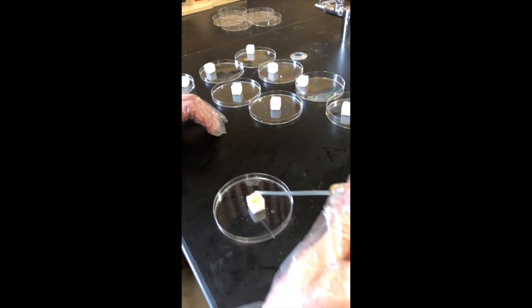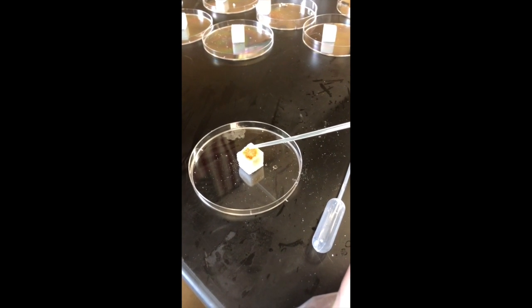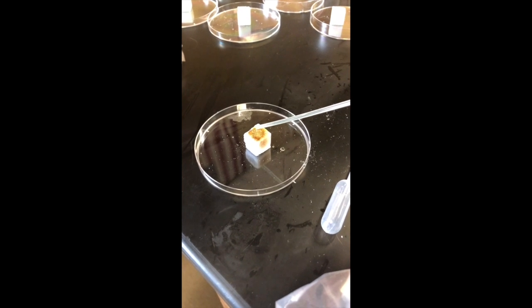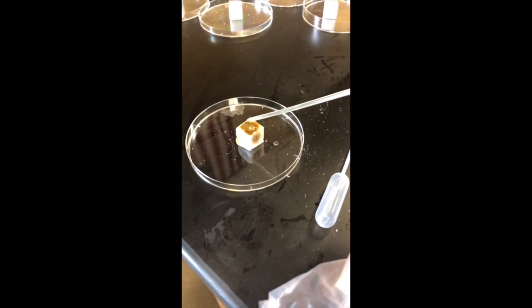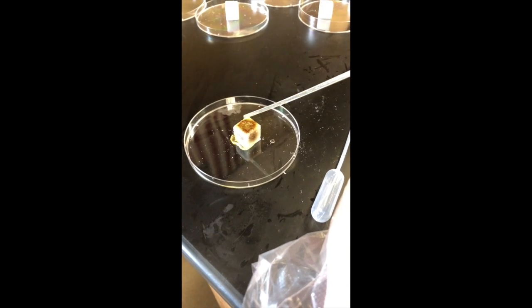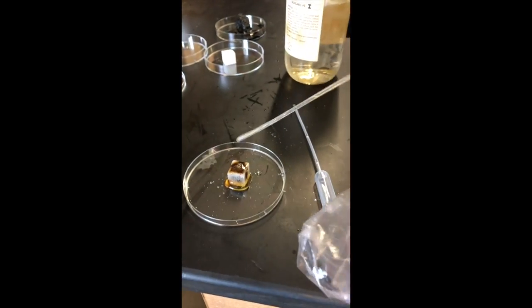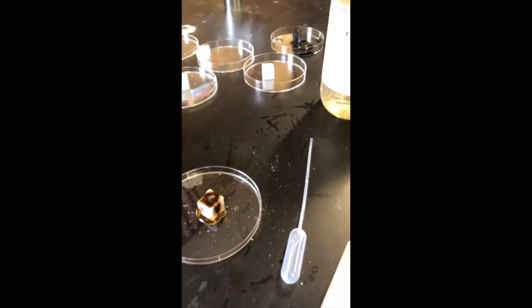Put them on. Okay, if you notice, there's a definite color change occurring. Keep going. Neato. Just put it all on. It looks like poo. Okay. Now you'll notice, what's happening to the sugar cube? It's burning. It looks like it's actual burning.